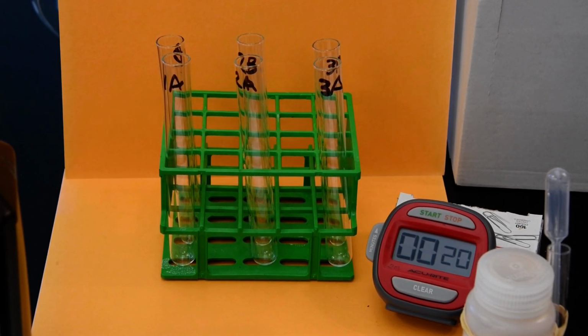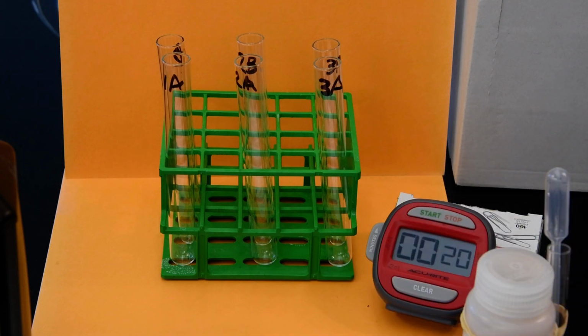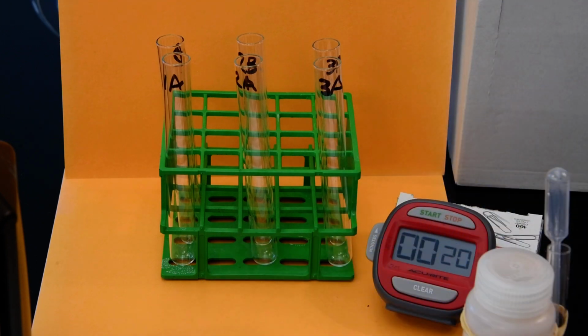All right. So in this first experiment we're going to do, I know technically in the introduction we set up an experiment to be done, but the first true experiment that we're going to see to completion is one that we do to illustrate the specificity of catalase.